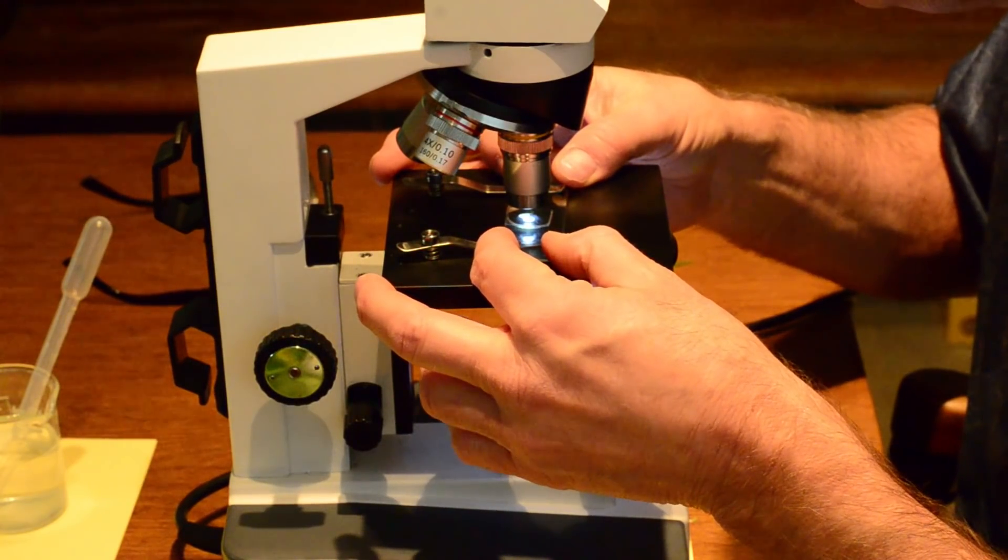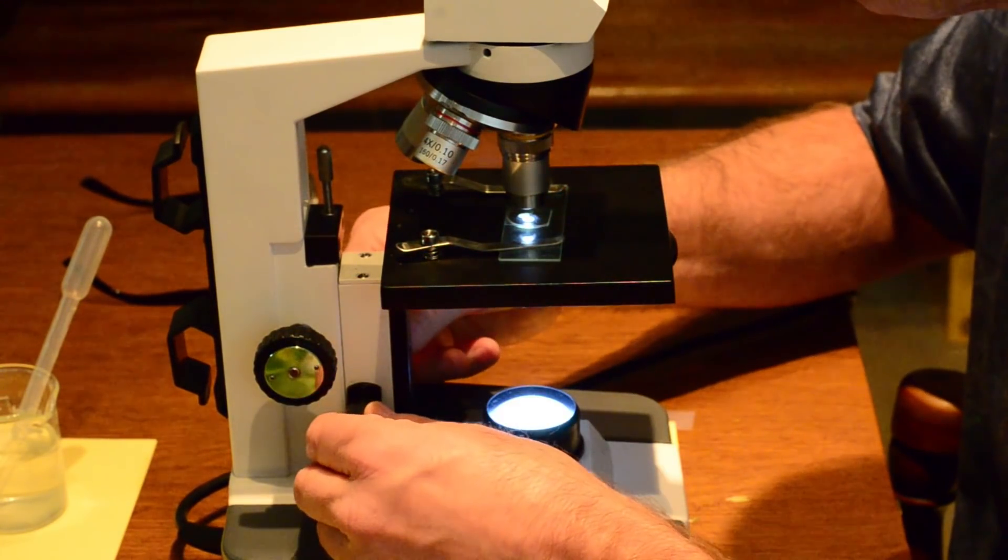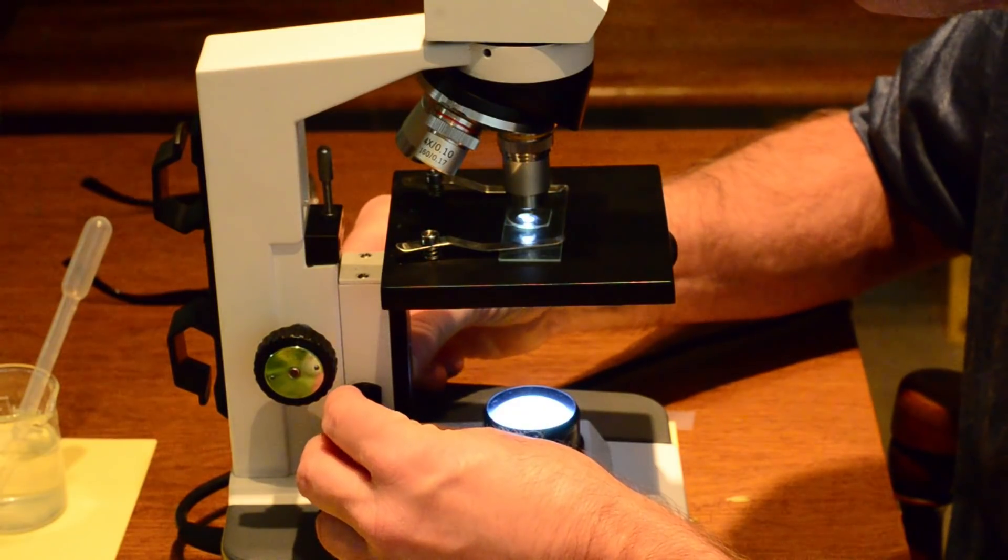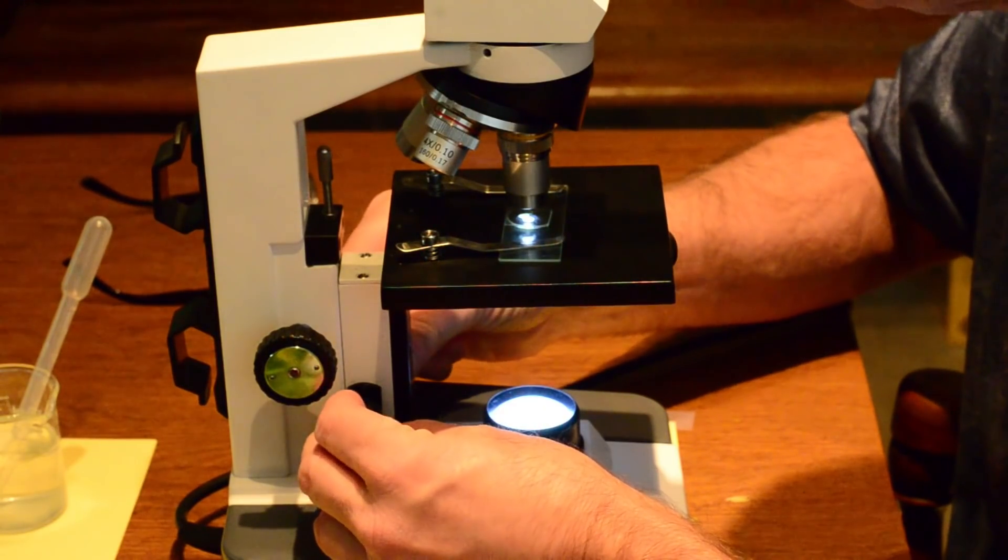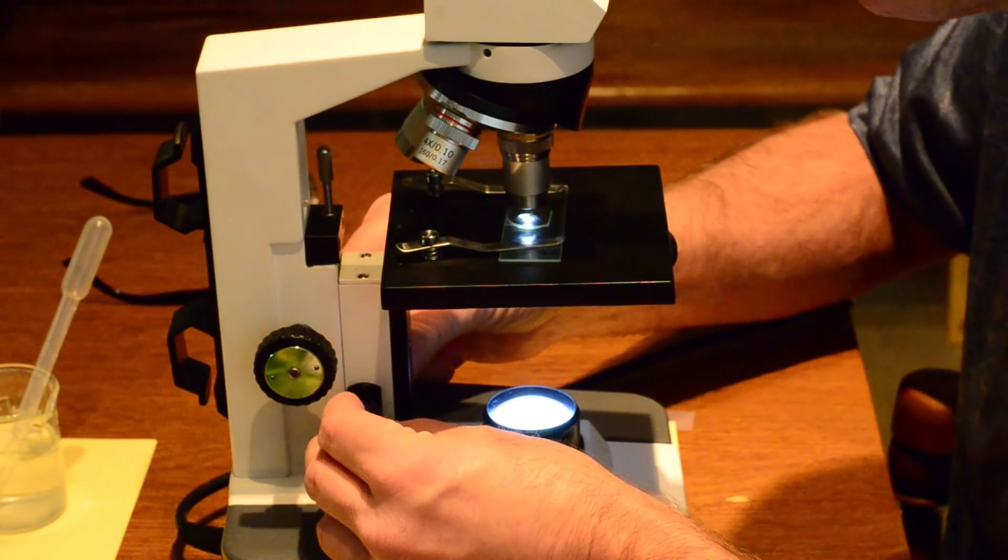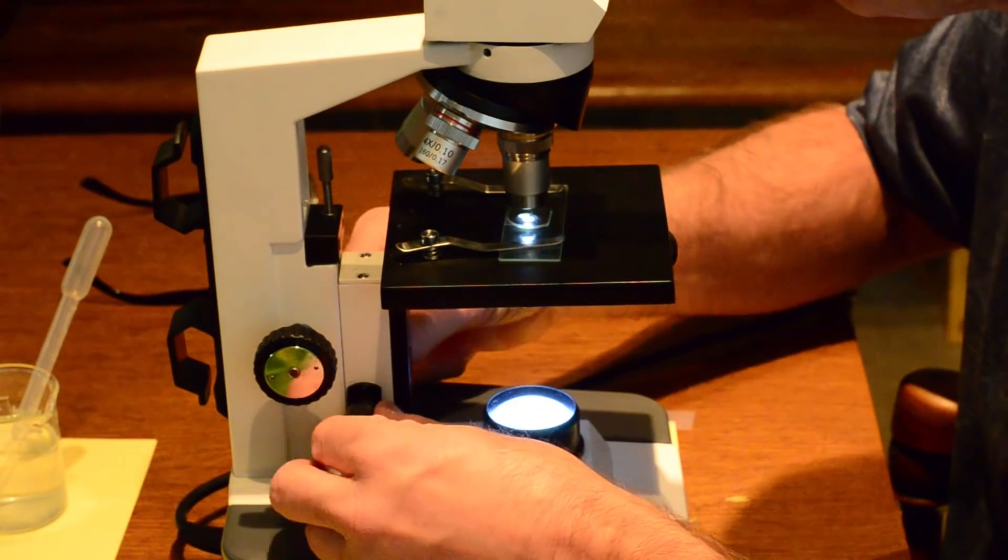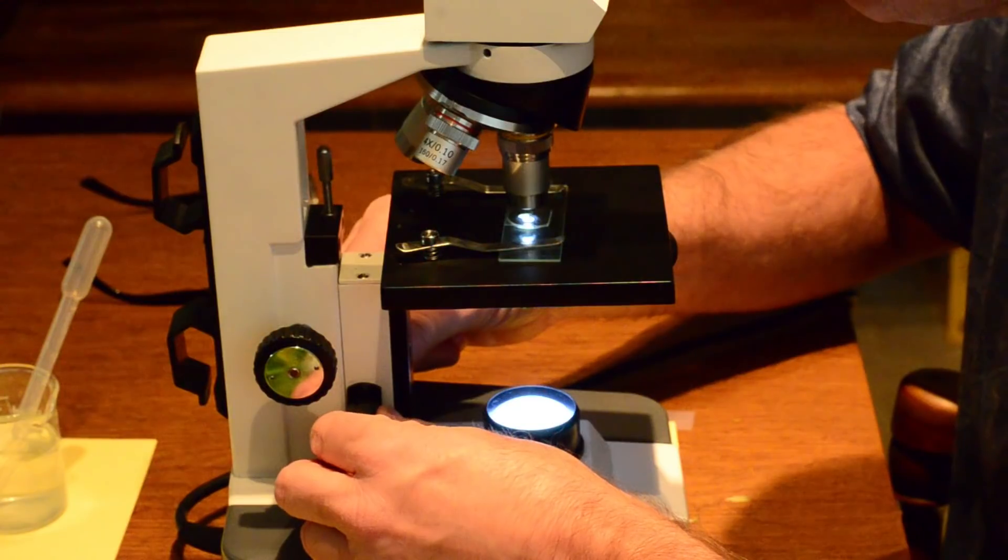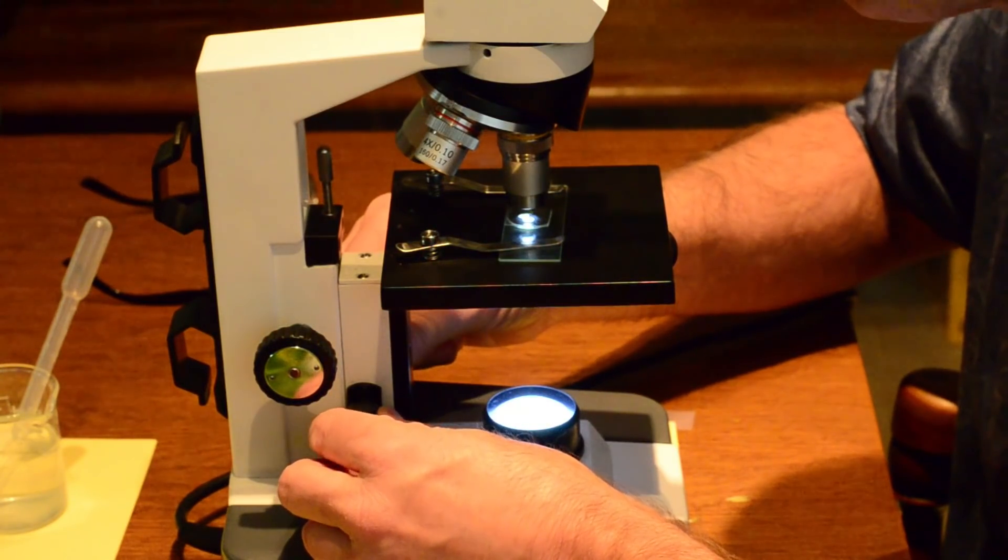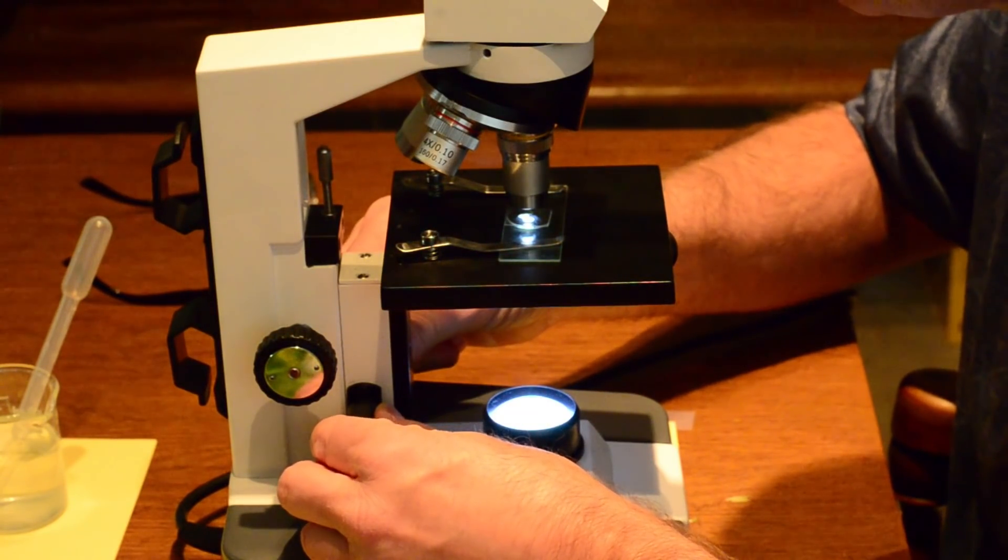Yes. That's a sweet spot. You can take pictures too. Remember. All right. You guys have got to see this. So what I need to have you do is remember safety first. I can see the cell wall, y'all. I should probably take a picture of that.